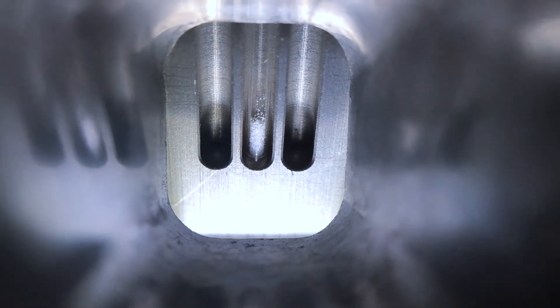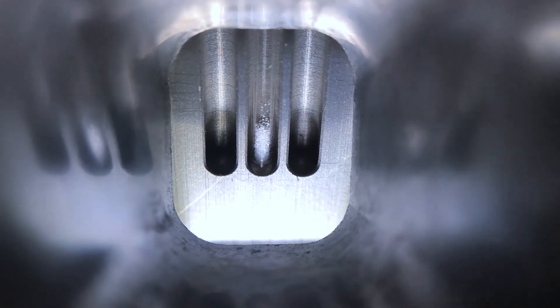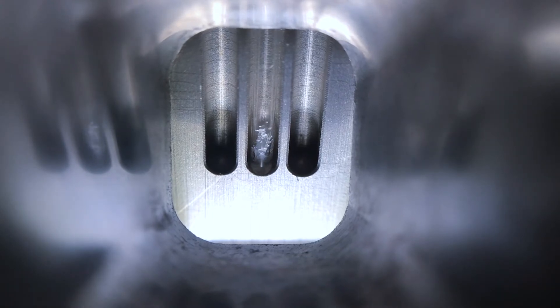Discard the used capillary in a specially designated waste jar. Never place capillaries into a broken glass bin.